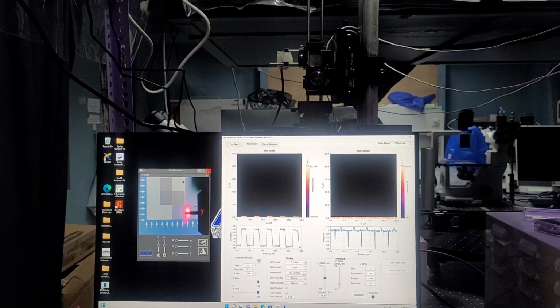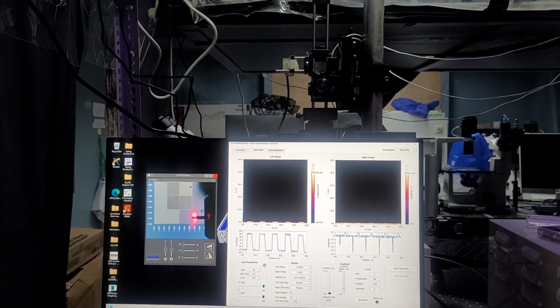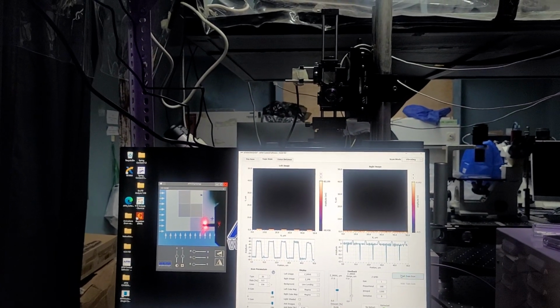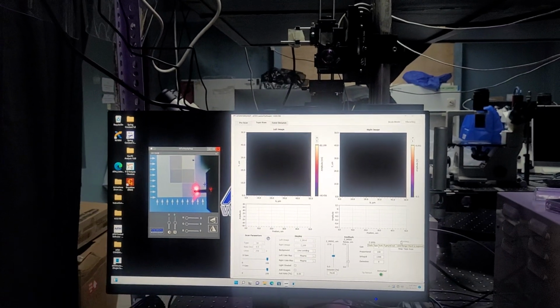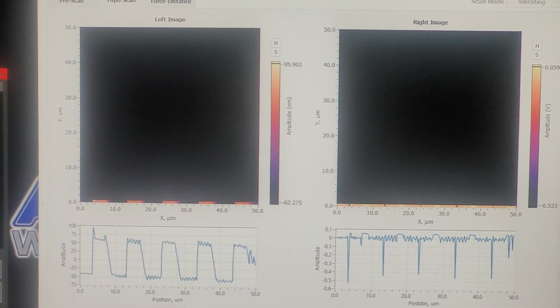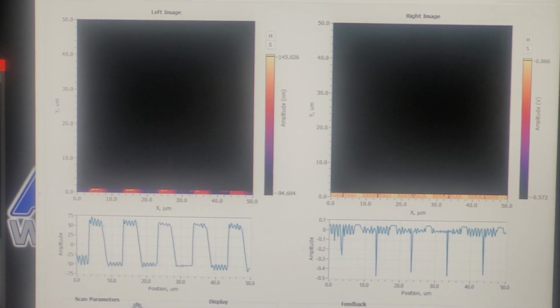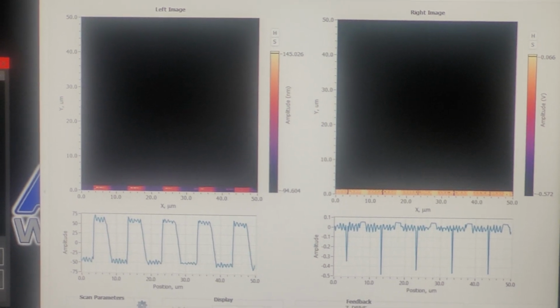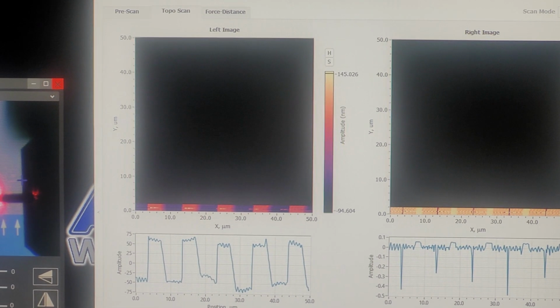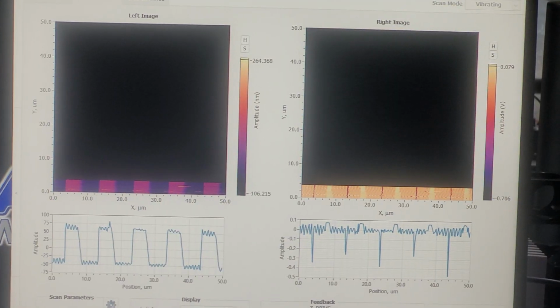Which quickly, let me just make sure. Okay, yeah, that does look bad. And so it's hard to tell if that is just environmental or the machine.